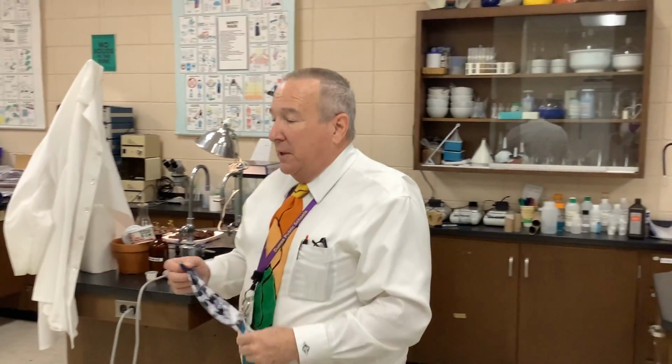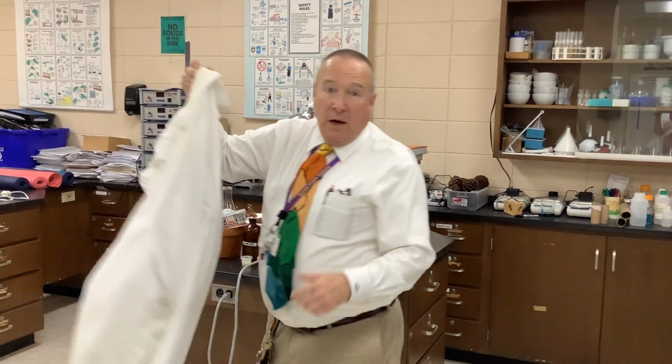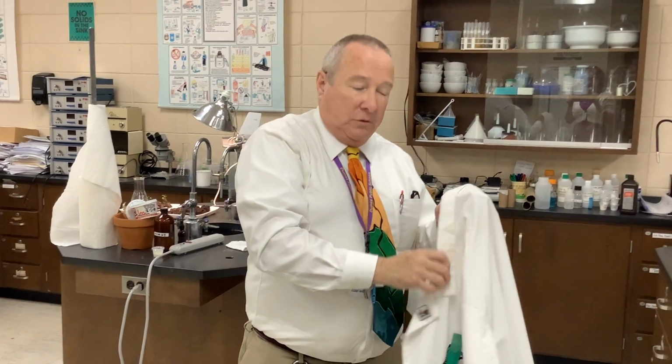It's not explosive, but it is a very dramatic demonstration, and it also introduces the concept of a catalyst and catalysis in chemical reactions. We're going to observe the breakdown of hydrogen peroxide. You observe it when you put it on a cut, and you see it bubble. What's happening there is it's breaking down into water and oxygen, and the little bubbles you see are oxygen bubbles.